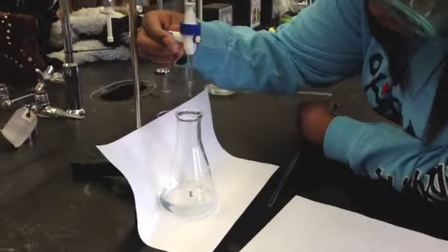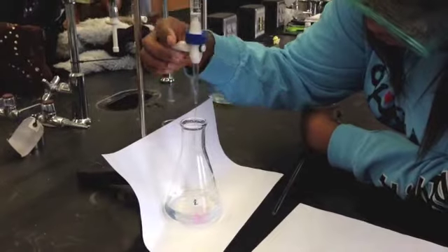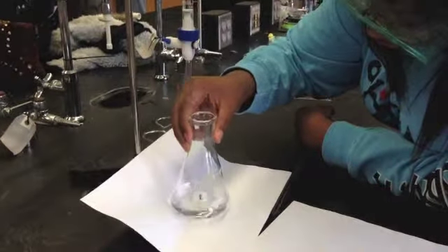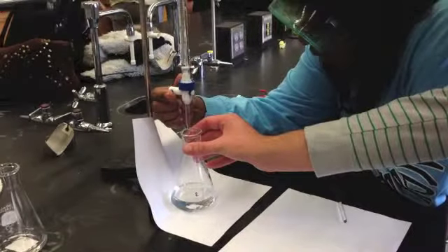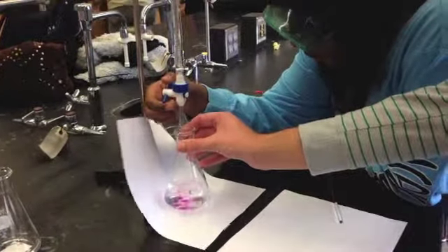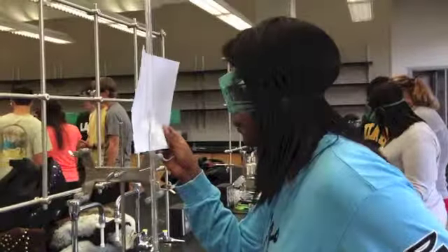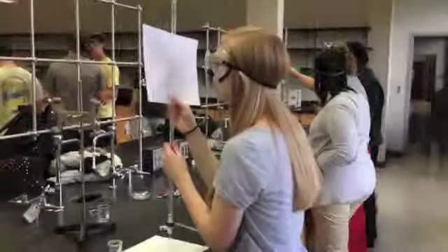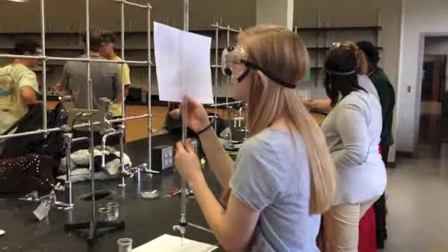Because sodium hydroxide is a strong base and KHP is a weak acid, when the reaction reaches the endpoint, the indicator phenolphthalein will become a faint pink. Be cautious when dispensing the sodium hydroxide because 1 drop can send the solution past its endpoint. If this occurs, the volume used to determine the unknown concentration will be incorrect.